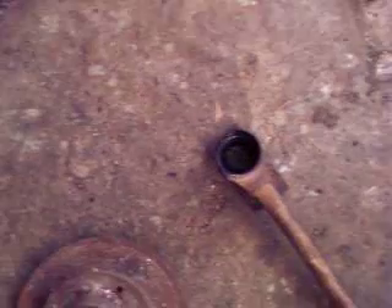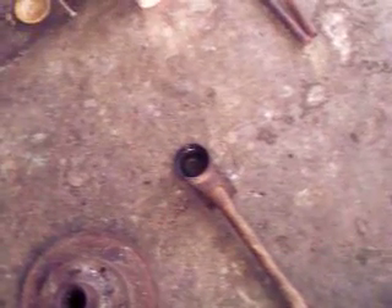Let it cool. And then, after it's cool, I will pop all the slag off of it. Collect the lead prill. And then we're going to scorify it. After it's scorified, pop the litharge off of it — which will contain the impurities — recover the lead, split it into two exact prills, and cupel down and recover the gold beads. We're at that point. Until then, stop the video and I'll pick it up at that point.